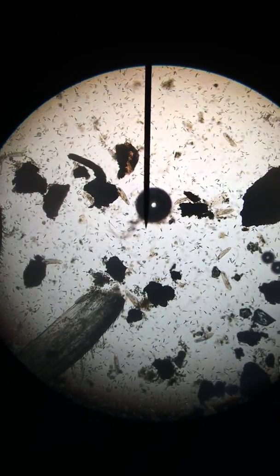Okay, here we have a sample taken from the middle bottom of your pond. This is a sunny afternoon, and this is about as far away as I could get from the sunny window. I went to the darkest depths. This was taken on Saturday, March 30th.